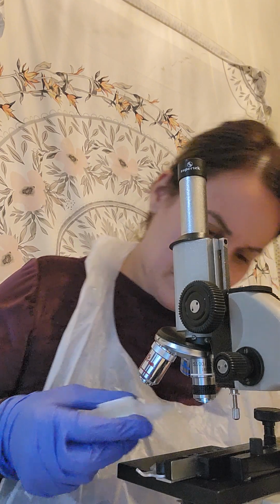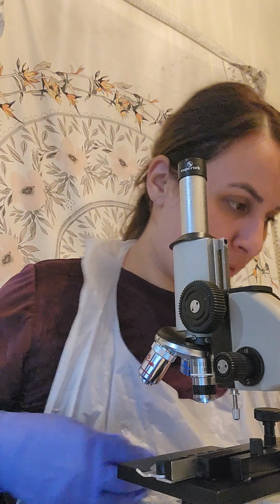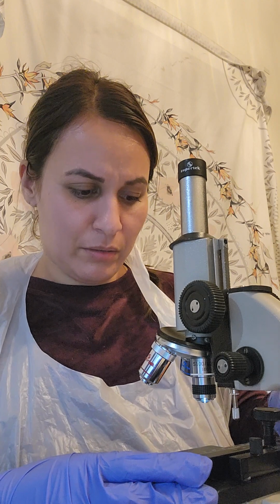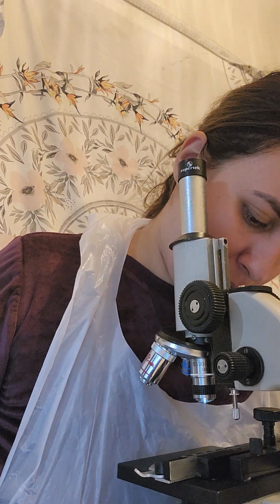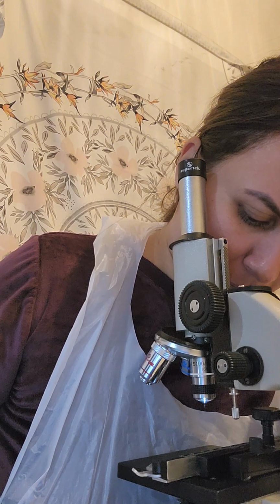Let me move this over a little bit to make sure the oil has the light going through it. There we go. Very good.